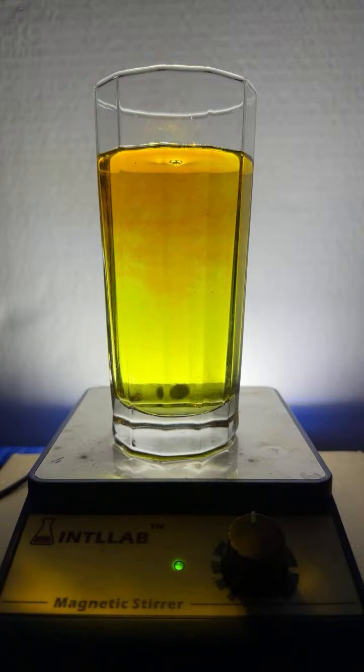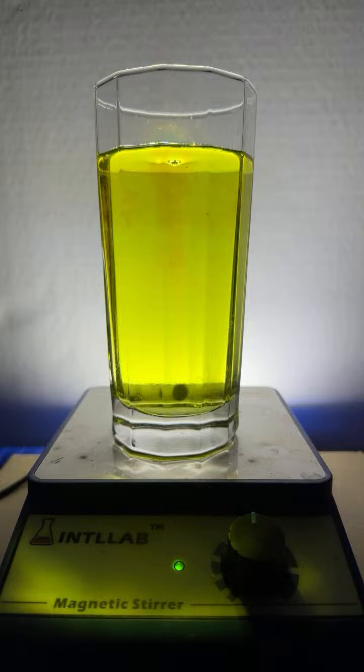Yeah, we could add some quinine. I don't have any with me. They are sweet there, Wolf. That's a little slightly green, isn't it? I'm going to keep adding some drops of acid, see if that green color can get a little deeper. I guess not. I guess we're kind of stuck at yellow, huh?